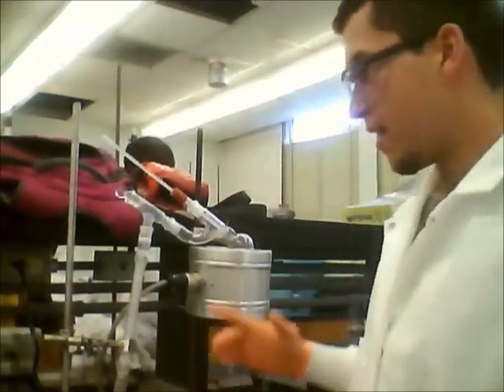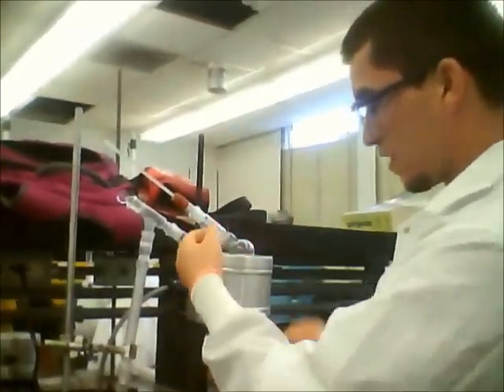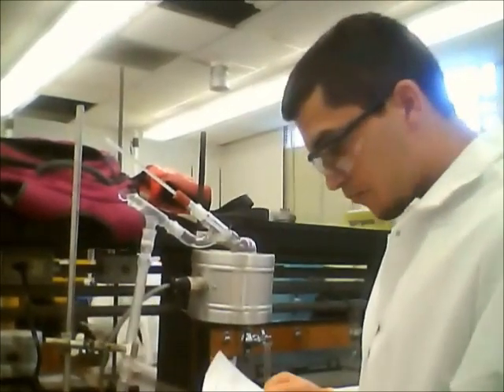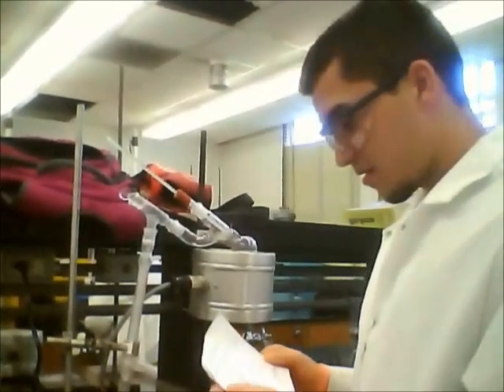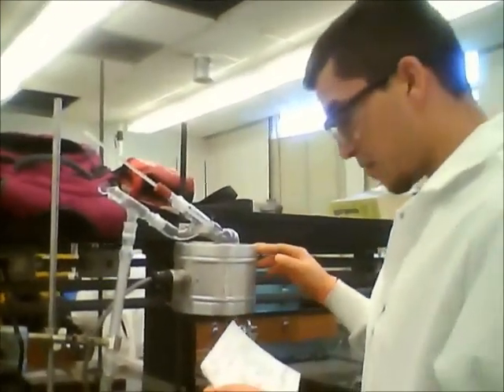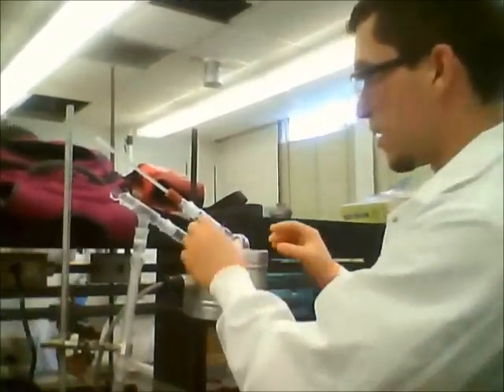This is the short path distillation. It has to be tilted in order for it to distill — if it's straight it's not going to distill at all, so it has to be tilted.